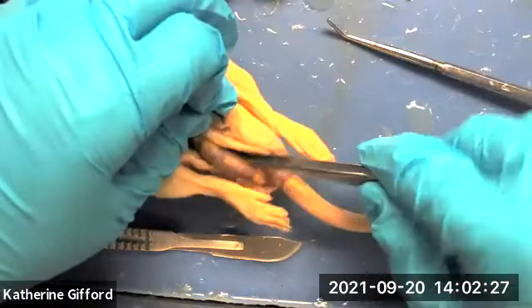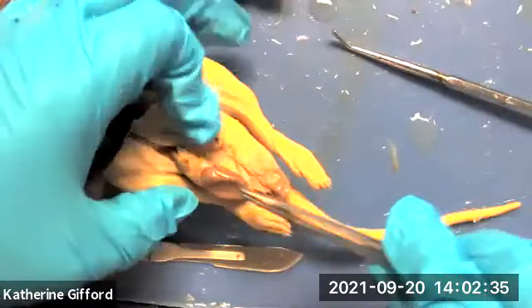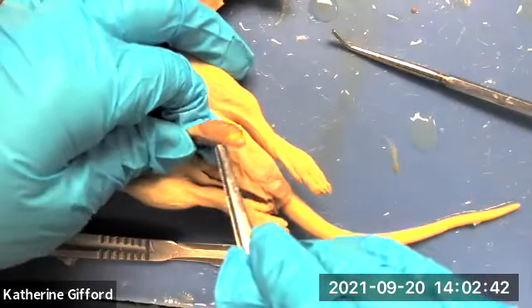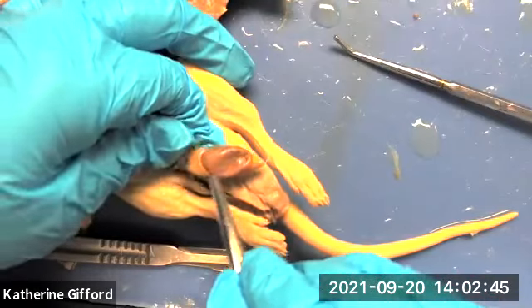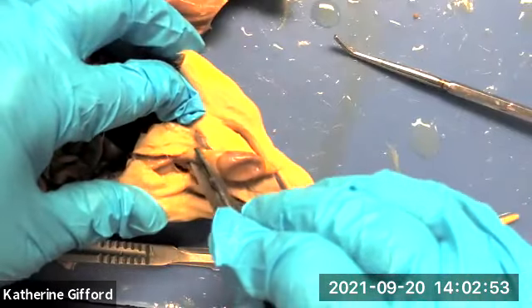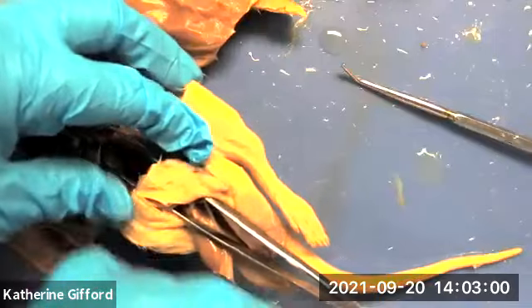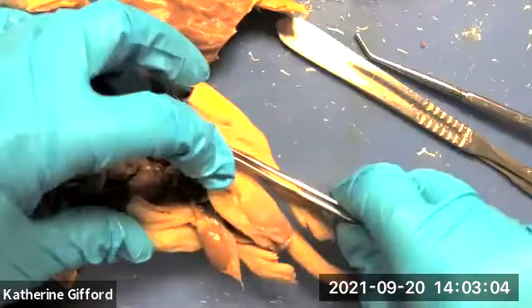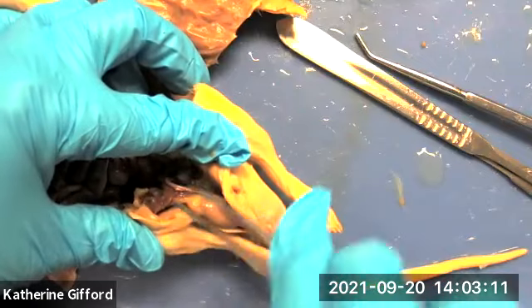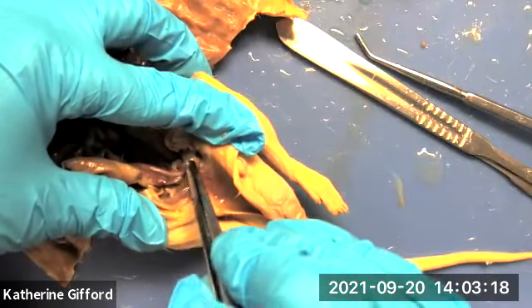We can scoop out one testis. You can see the epididymis here — it comes around and folds back and then becomes the vas deferens. This would be more of the epididymis, and you can see that vas deferens going up and looping back near the urinary bladder.